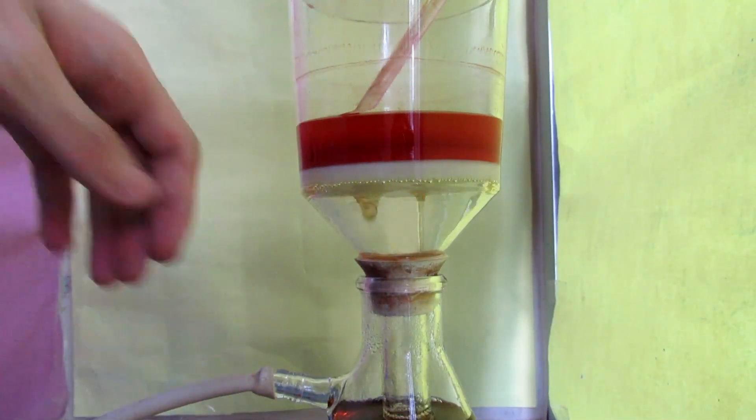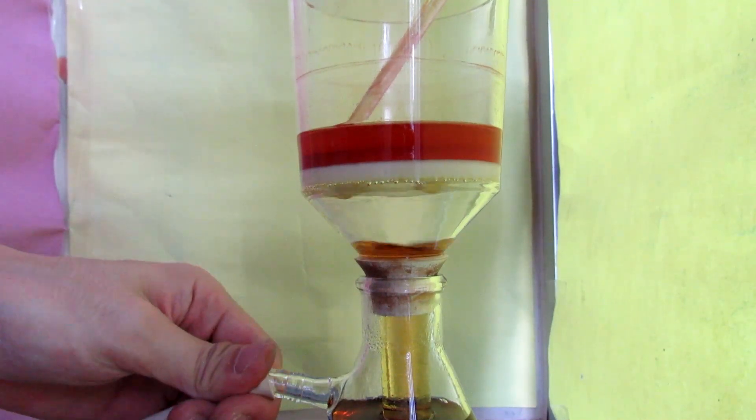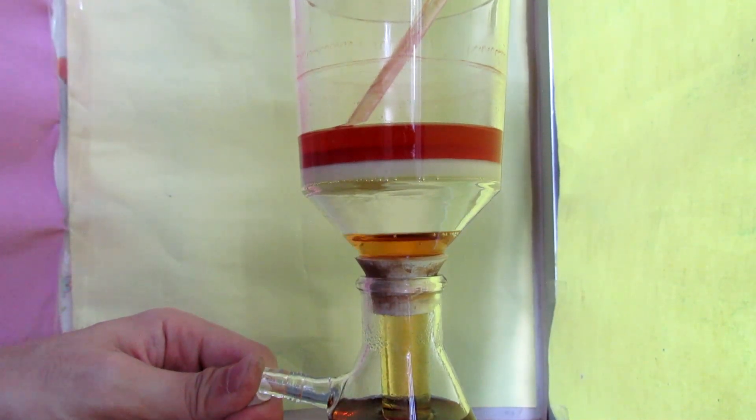As you can see, the filtrate is tinted orange. I am not very sure why. Maybe it is due to the decomposed sugar.